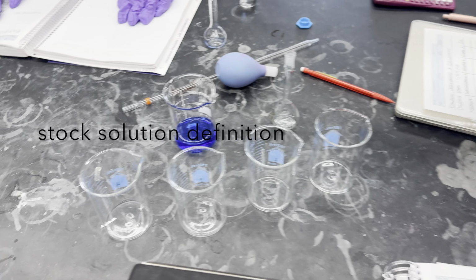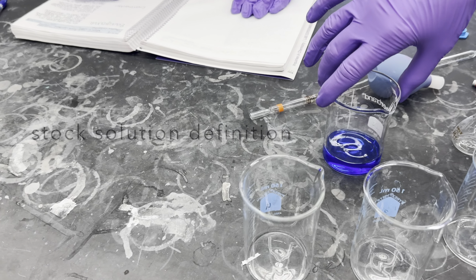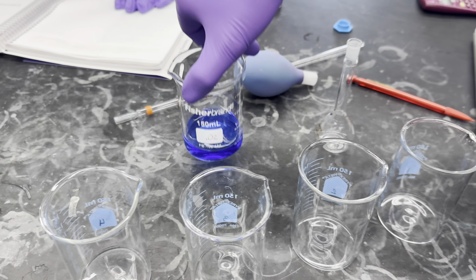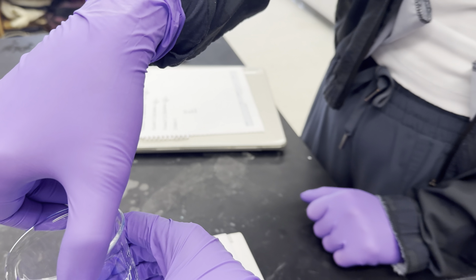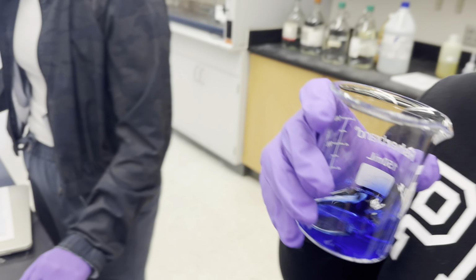solution. A stock solution is a concentrated solution that can be diluted to a lower concentration. Our stock solution was transferred from the stock container into a new 150 milliliter beaker.